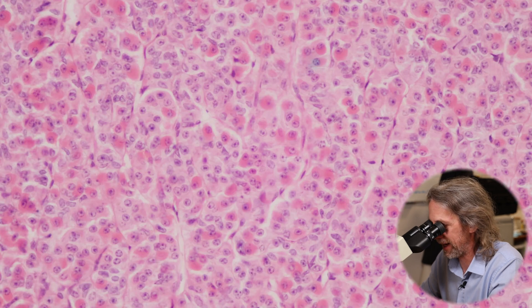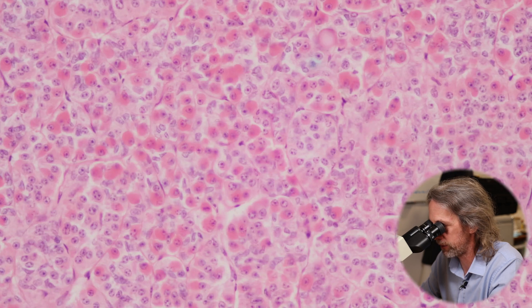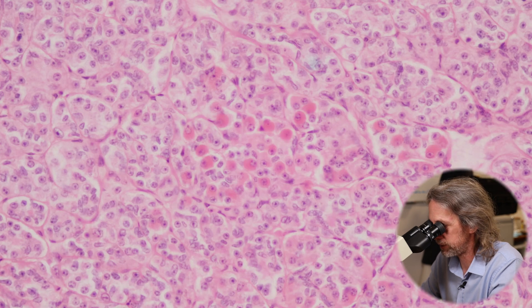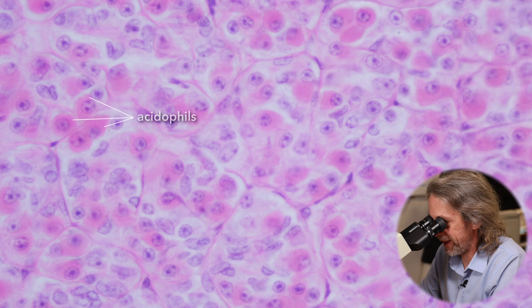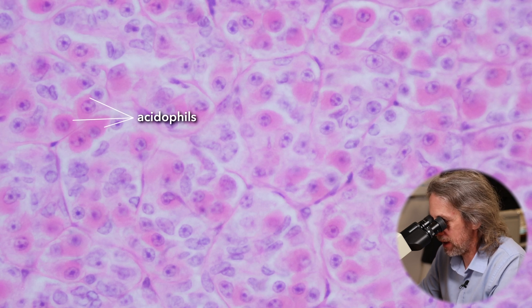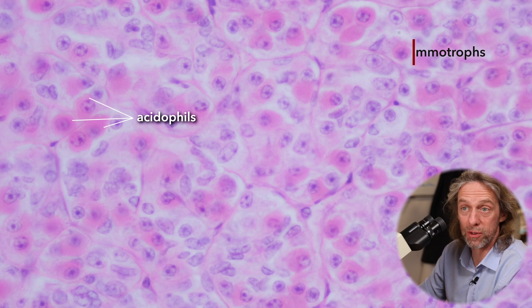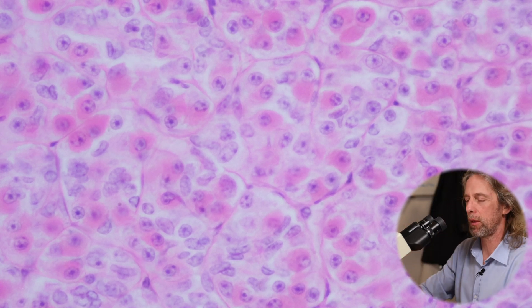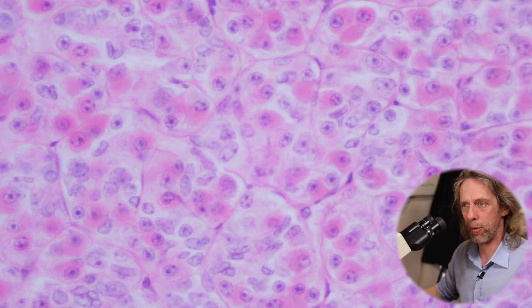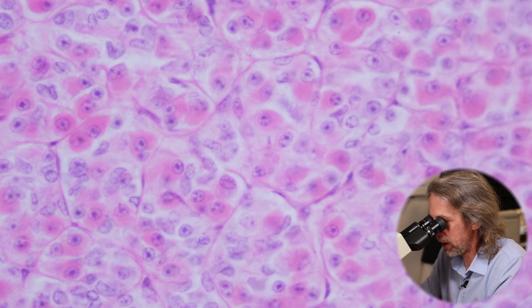With this stain I can't identify each individual cell type — I'd need in situ hybridization or immunohistochemistry for that. But we can identify two broad types: look at these really pink cells here — those are acidophils, they like acidic dyes. Those acidophil cells will be either somatotrophs that make growth hormone, or mammotrophs (also known as lactotrophs) that produce prolactin. Somatotrophs drive growth; mammotrophs drive milk production in the breast after pregnancy.